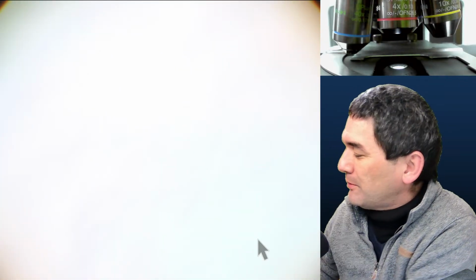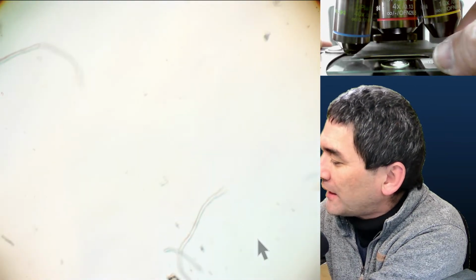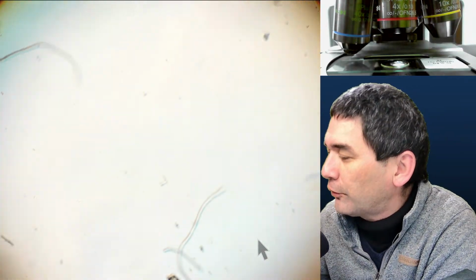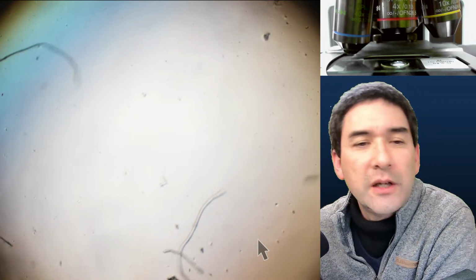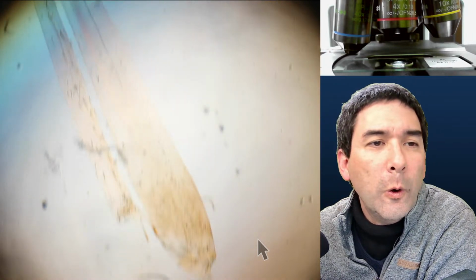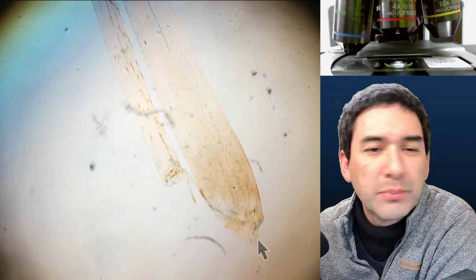So also maybe not the easiest to mount, obviously. The butterfly leg whole mount. Okay, so the next one is the leg of a butterfly. I always regret a little bit that they do not give us more information about which type of butterfly it is and so on. I have to find it because I have no idea. Oh, here it is. This is pretty transparent.